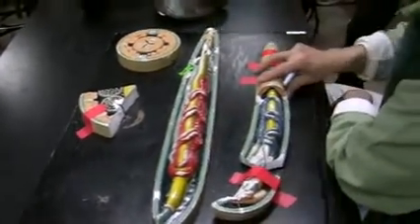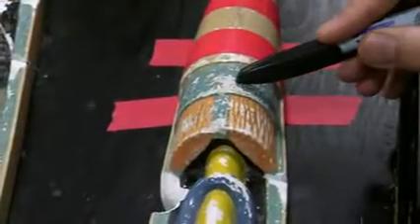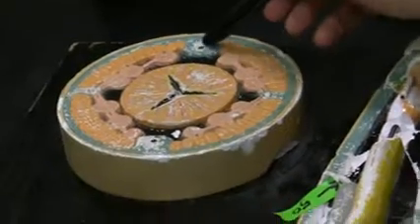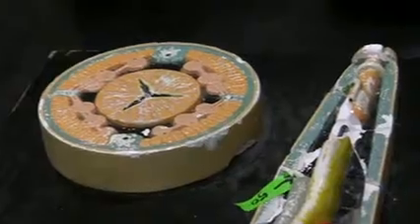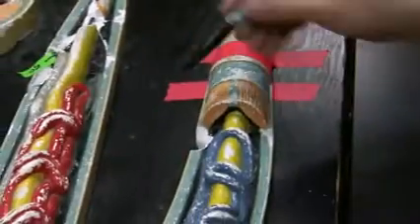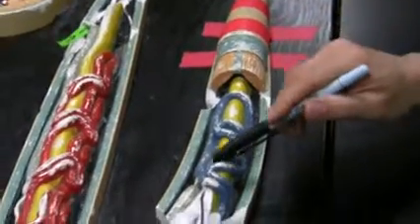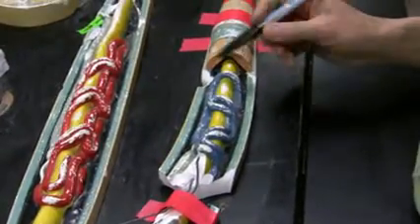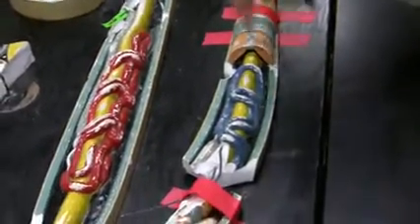You can see that. Right here in the male, they're showing you the cuticle, hypodermis. Hypodermis runs through the lateral line. See, lateral line, hypodermis. And then right here is excretory canal that runs through it. So longitudinal muscles, no circular muscles in these animals. Intestine. And right here again, the artist and the biologist could not communicate very well. The testes supposed to be very small, vas deferens a little bit bigger, seminal vesicles a little bit bigger, and so on and so forth.